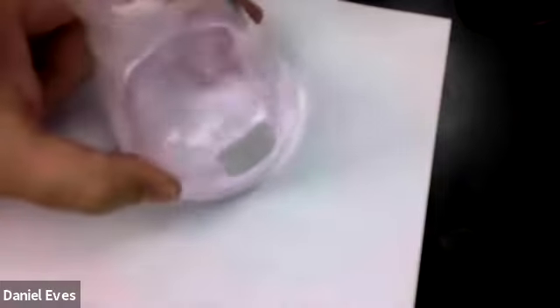Let's see if we're there. We are. Okay, so we are just below 48. So 48.15, I would say. So 48.15 milliliters it took to change this to the pink.